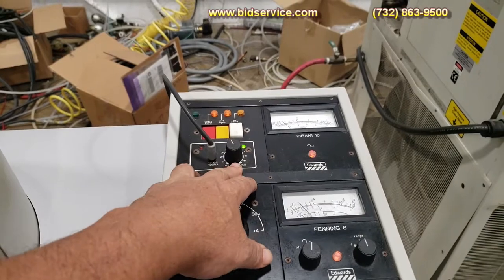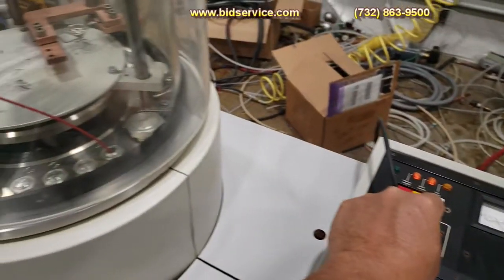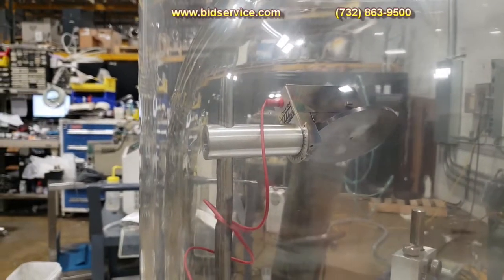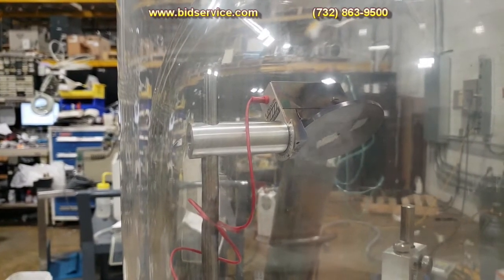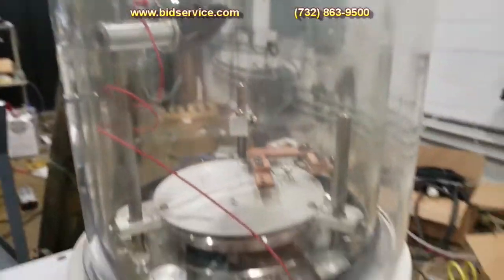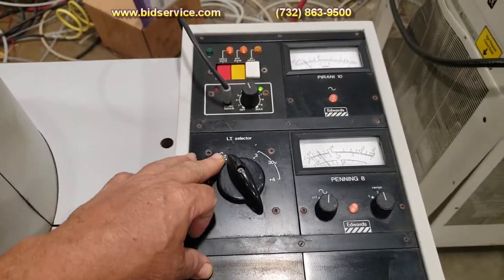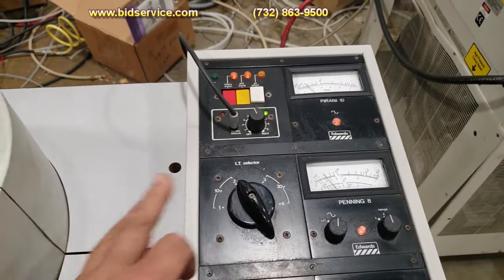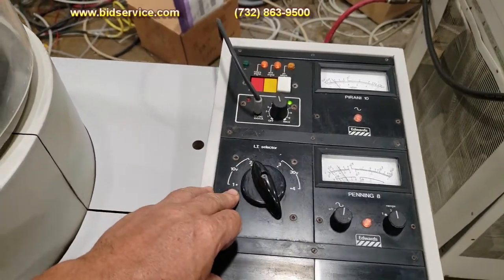Here is your rototilt — if you want you can speed it up or slow it down. Next you have your selector switch for your different thermal sources, but since you only have one, basically keep this on two and you'll be fine.